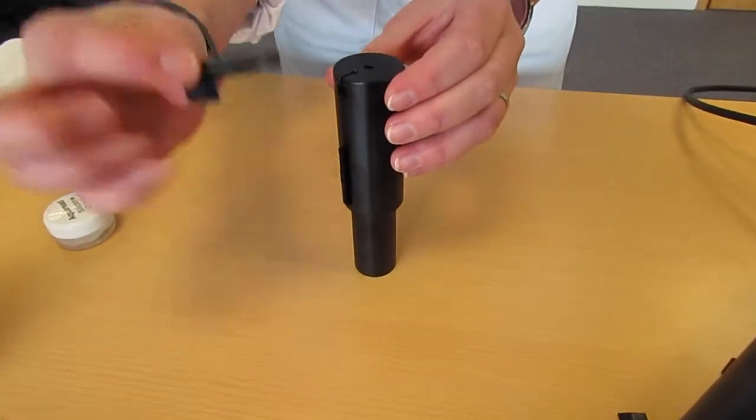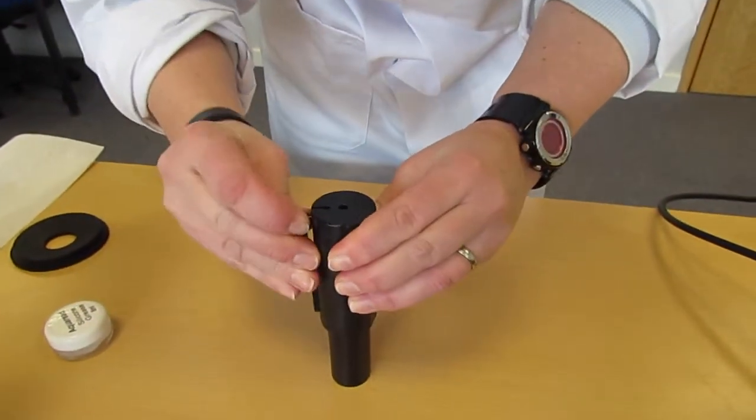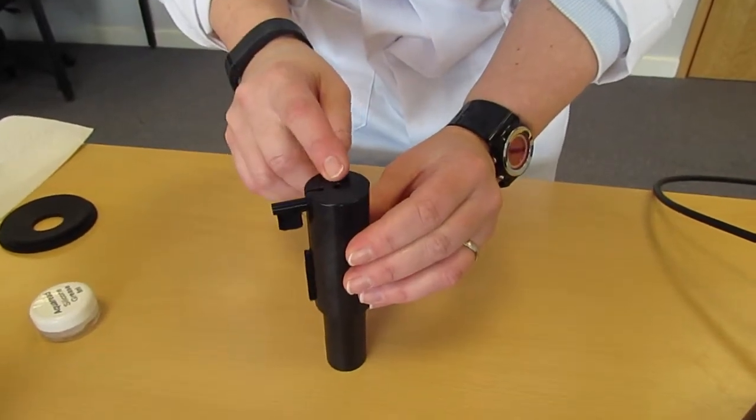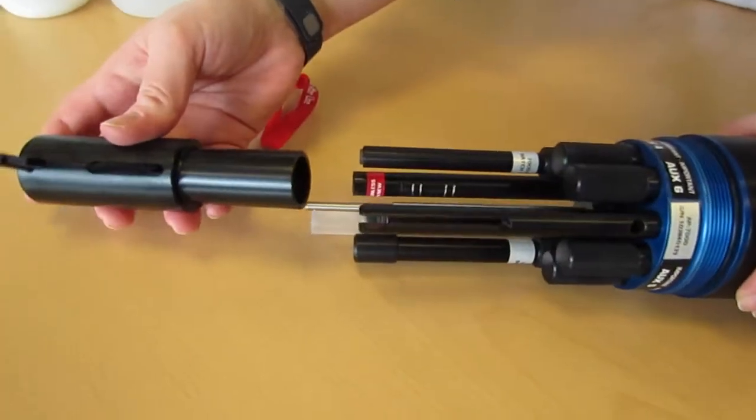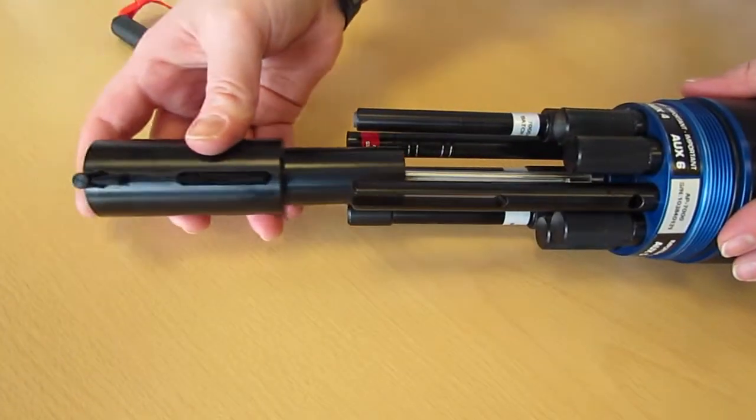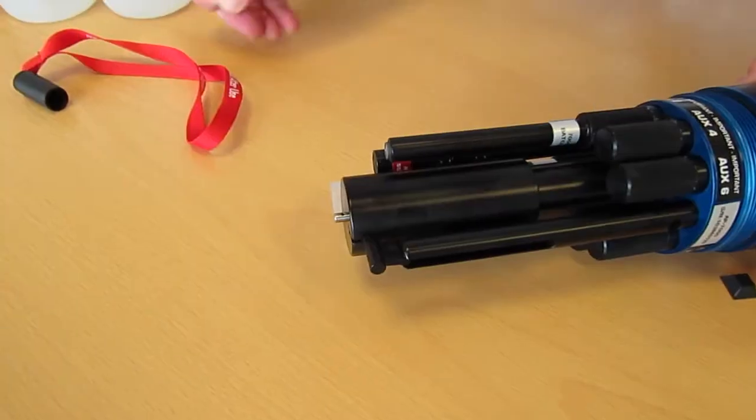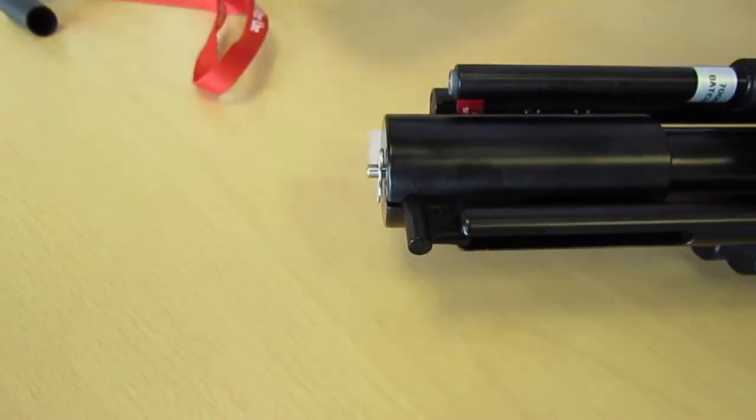These are then fitted together with the brush facing down into the wiper arm. This can then be fitted, this brush lines up with this socket. This is then fitted into the AP7000 and the pin installed.